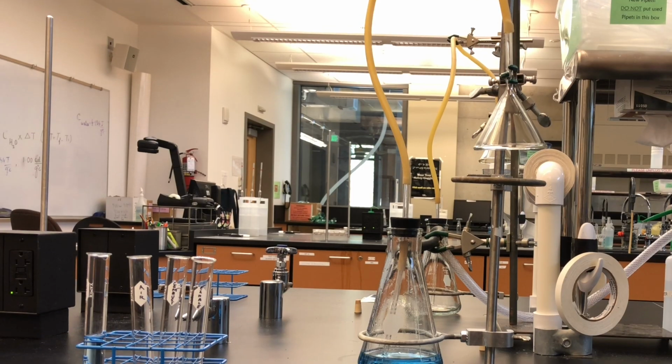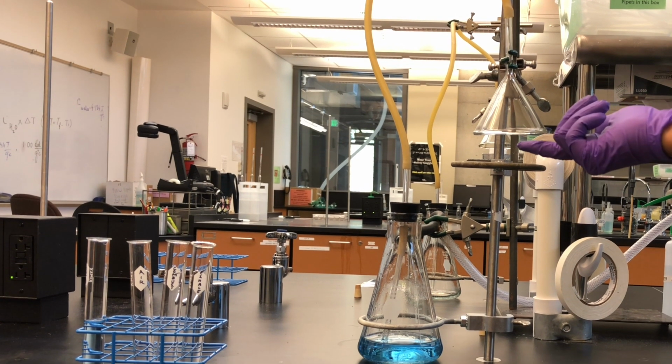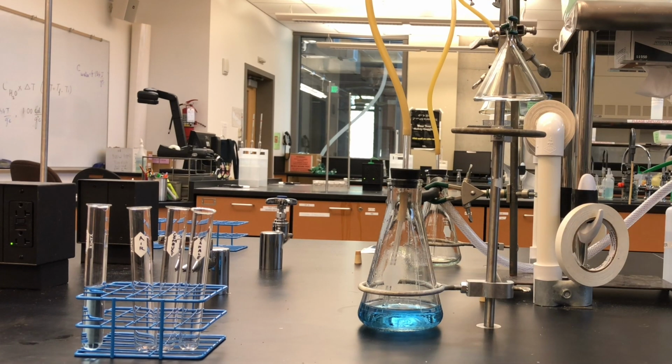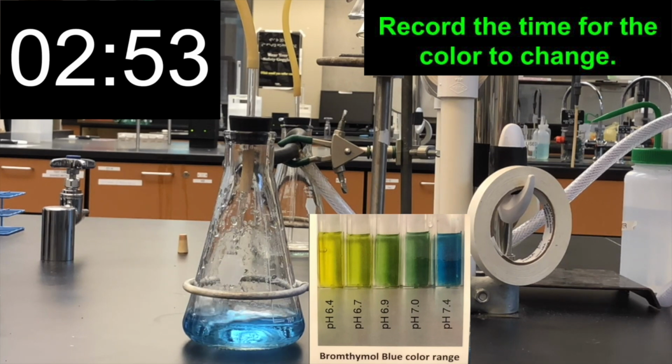Assemble all the apparatus. The air from the atmosphere will be sucked in through the inverted funnel into the vacuum flask. The carbon dioxide in the air will react with the water. Turn on the vacuum aspirator. Observe the reaction and record the time needed to turn the color of the solution from blue to yellow.